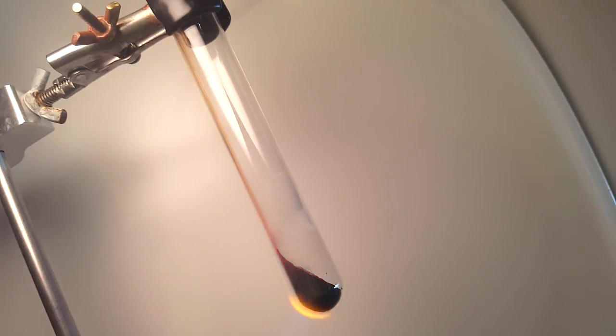Over time, you begin to see metallic mercury condensing on the sides of the test tube in a ring. It continues to condense in that cool area, and will soon enough coalesce into small spheres of pure mercury metal.